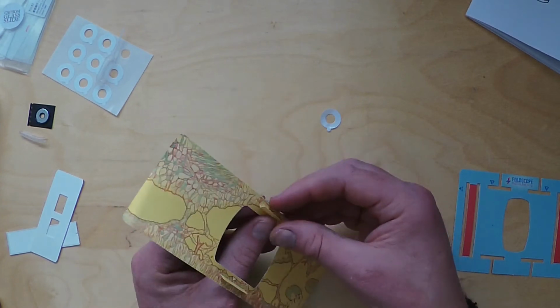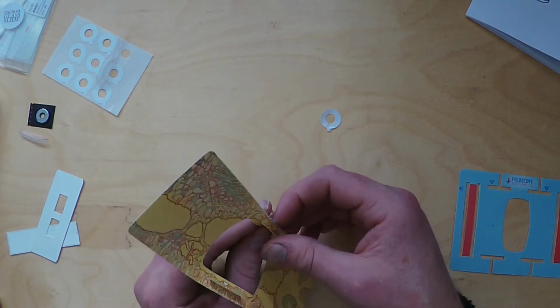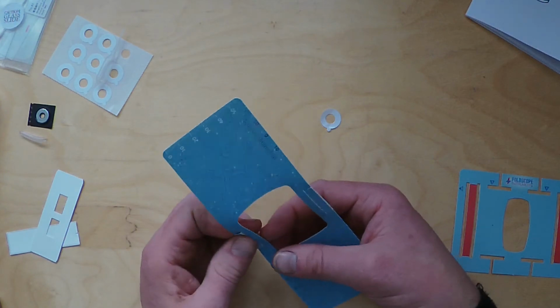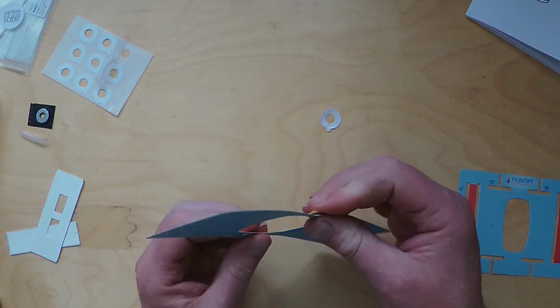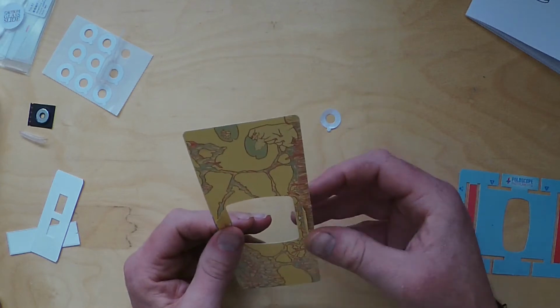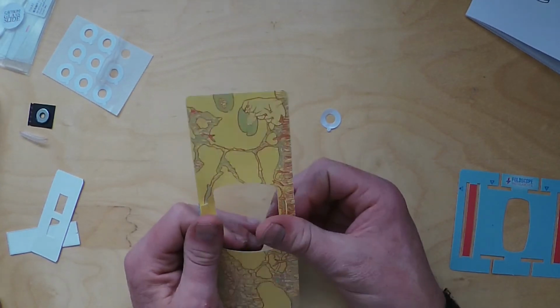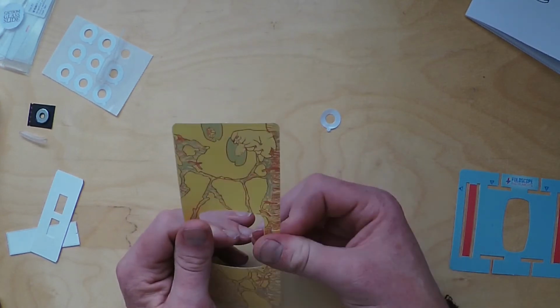And there's now a little way of tucking in a sample slide in that little gap, and then the fold of these flaps just give it that sort of tension, enough tension to hold the sample still. That's the idea.